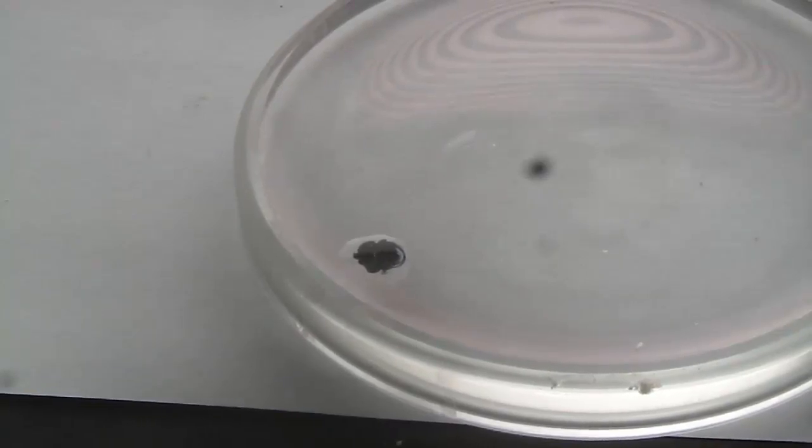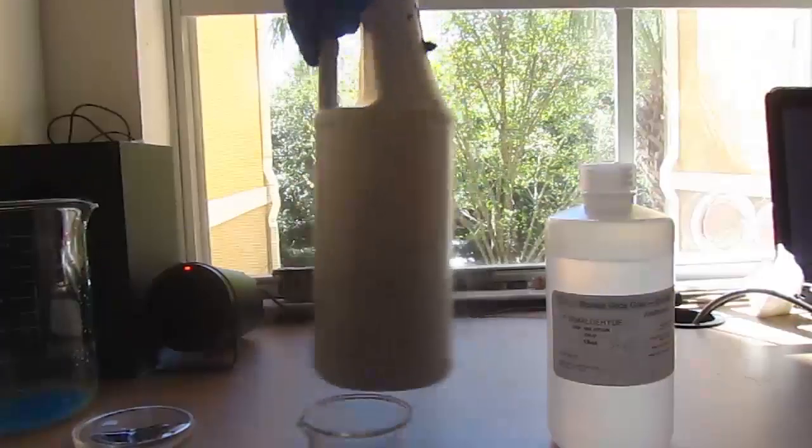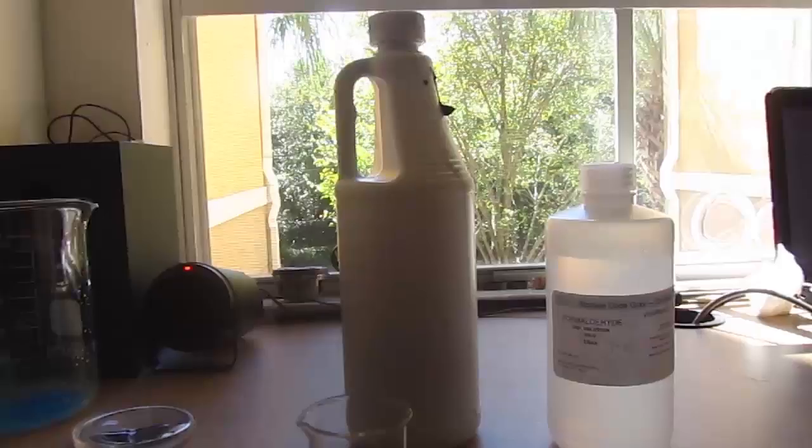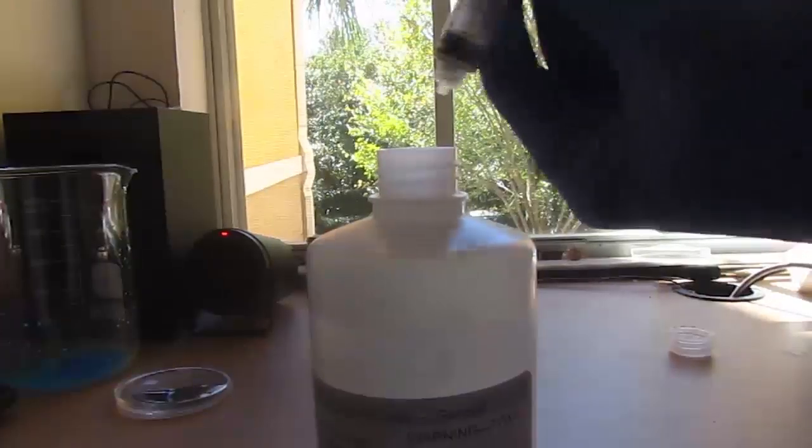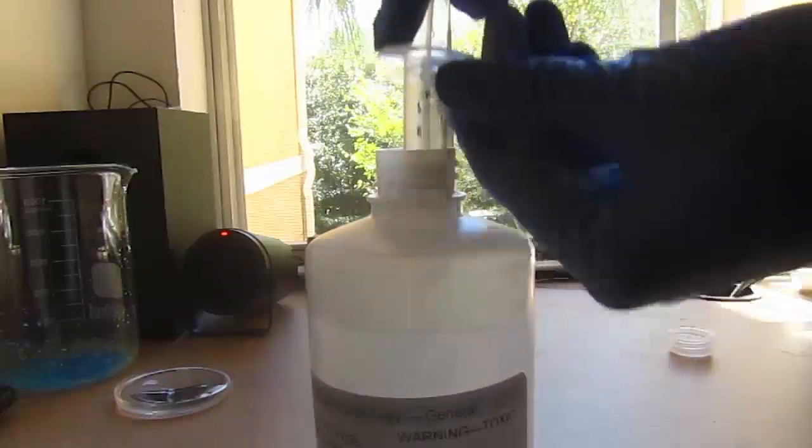And it's a pretty easy thing to make. You use formaldehyde and sulfuric acid. Both of these bottles were purchased. They were $10, and you could make over a liter for $20 compared to 20 milliliters for $20 commercially.